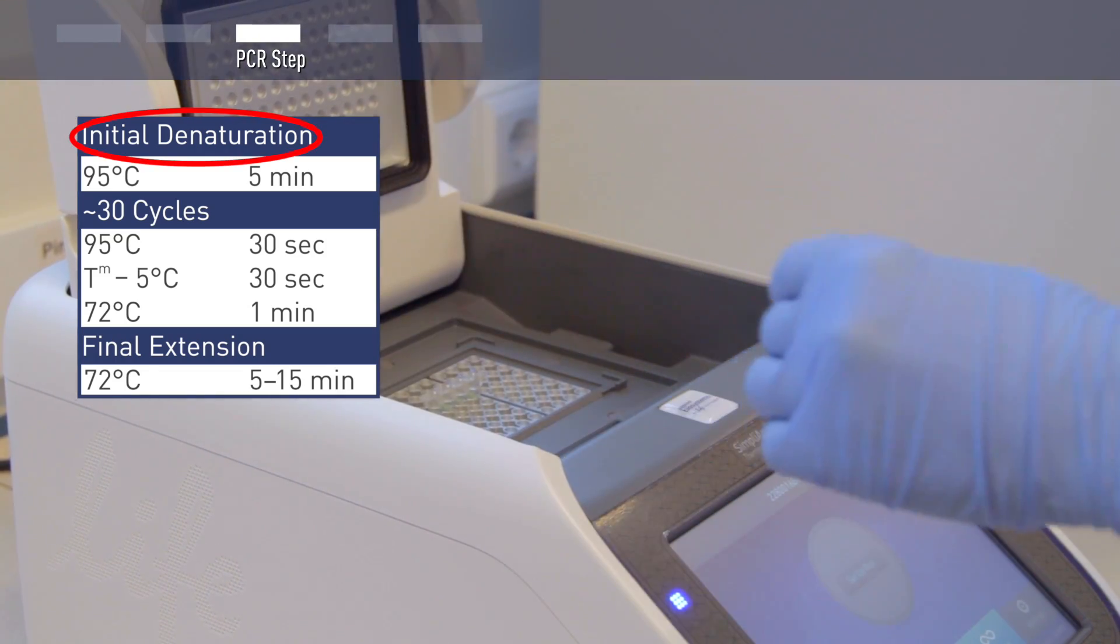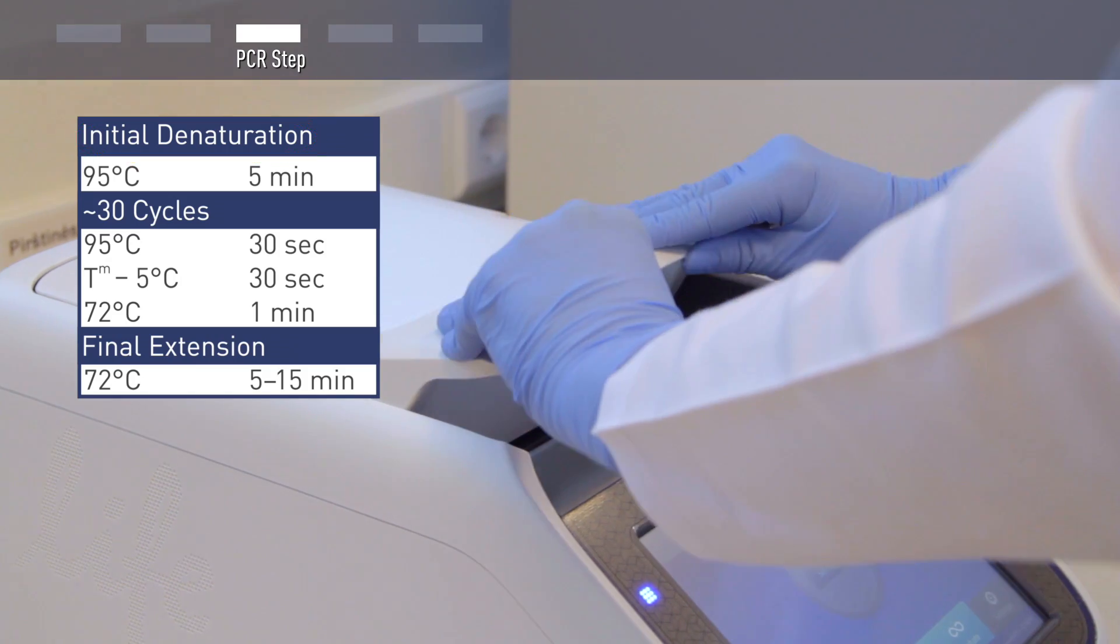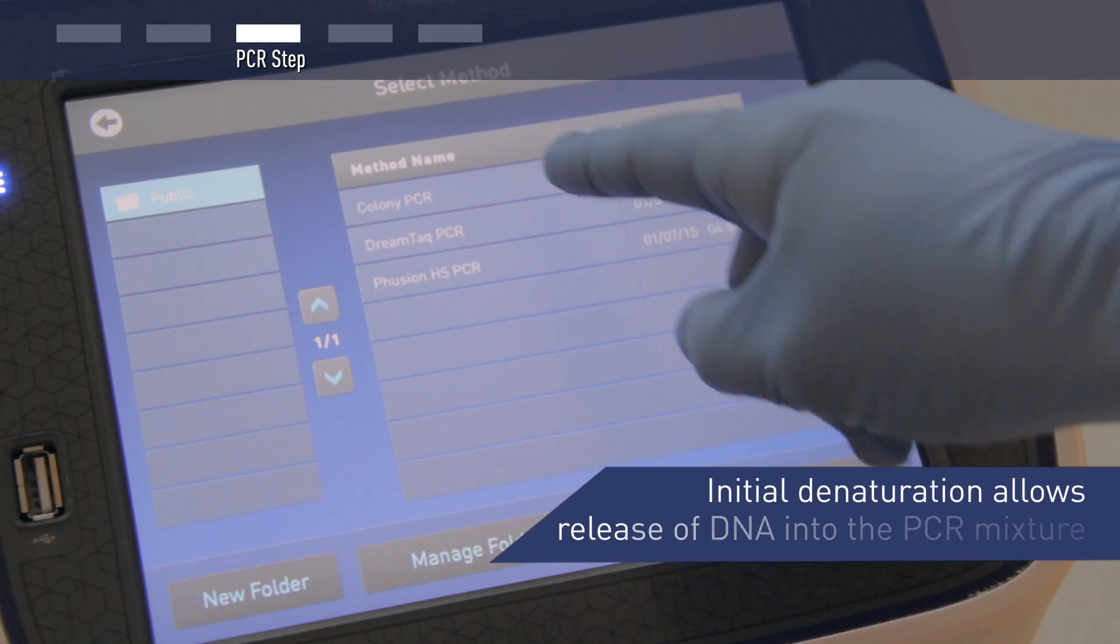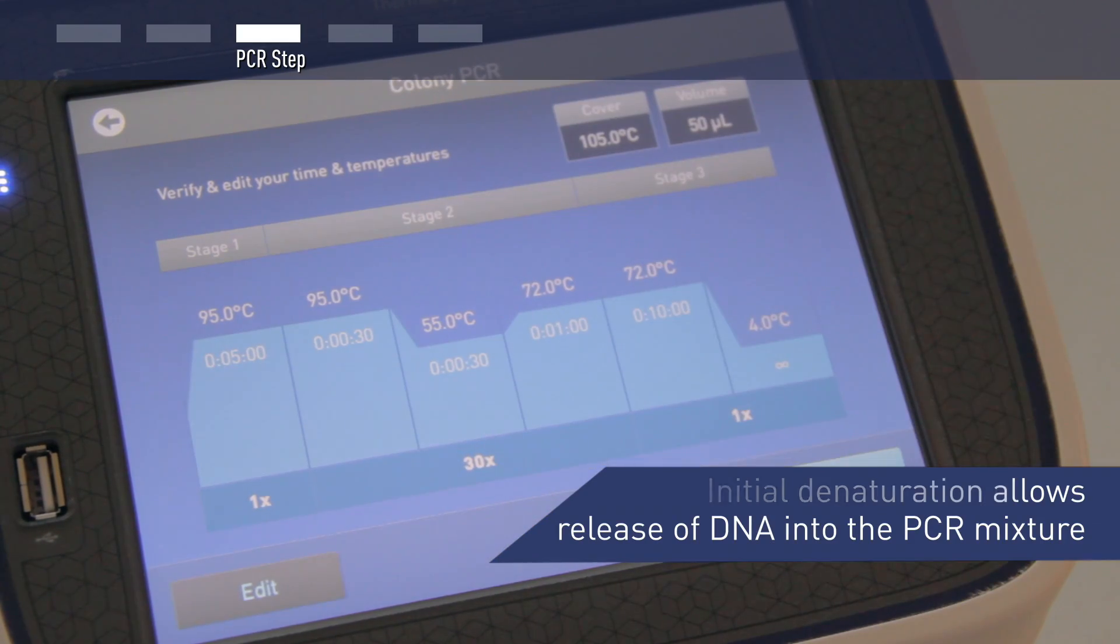Make sure to include a five-minute initial denaturation step which will allow release of the DNA from bacterial cells into the PCR mixture.